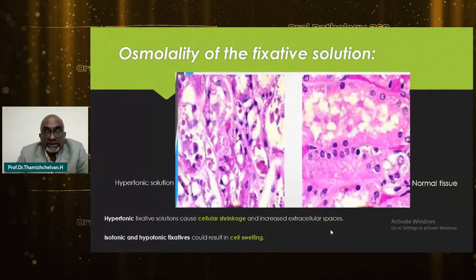Now, the osmolarity of the fixative solution is very important, because either more or less can cause tissue damage. The osmolarity of the fixative should be kept at the proper level. Either too many salts or too few salts can cause distortion. On the left, you see a tissue in a hypertonic solution, where the architecture is completely changed.